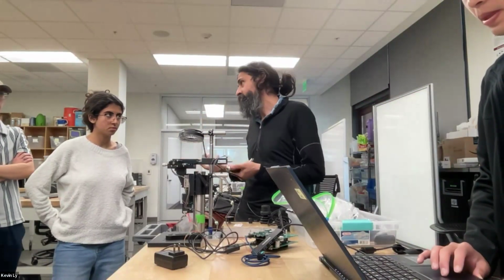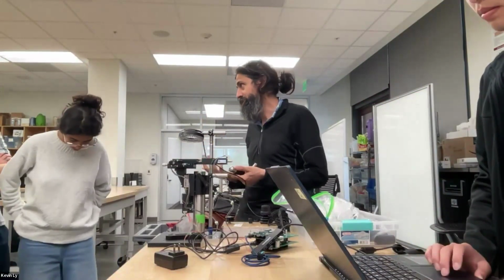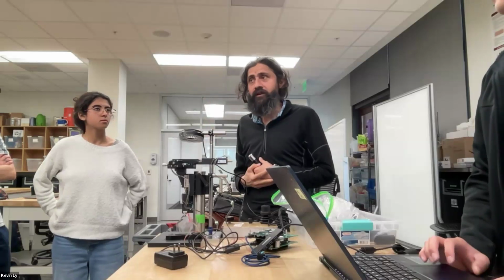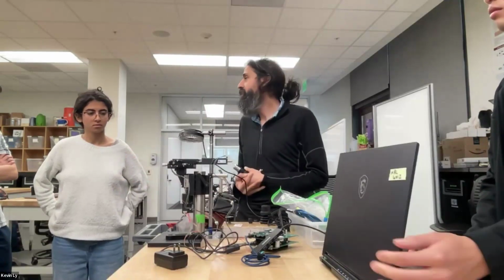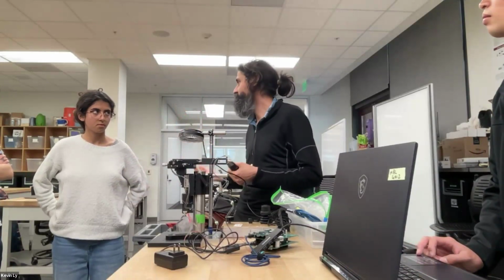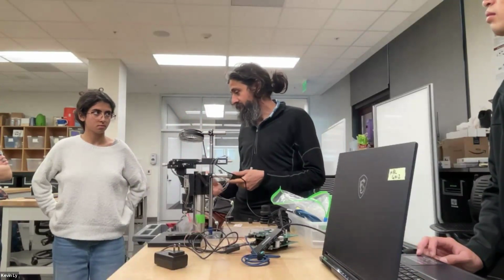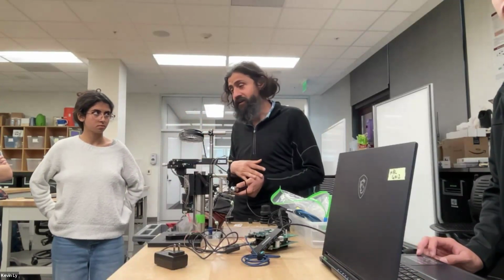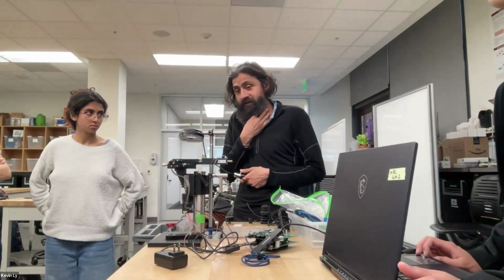And of course, manual microscopes are good, but there's a lot of times when you're trying to do something where automation is critical. You might want to image a coral underwater and you want to do that over 24 hours. And the focus is going to change because the weather is changing and the temperature is changing and something suddenly moved. You want to be able to write code to interpret the data that you're collecting and feed it back. So suddenly actuators become important. Most microscopes nowadays are automated.